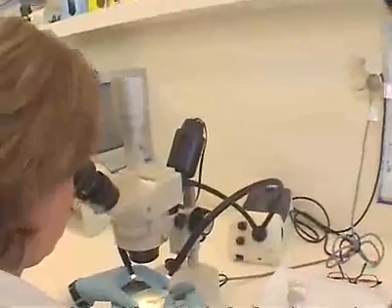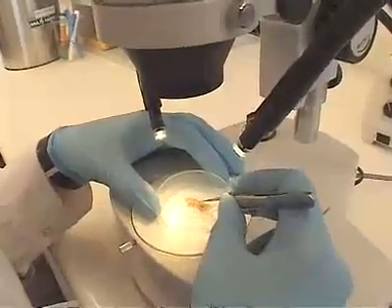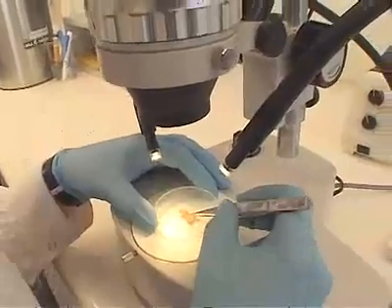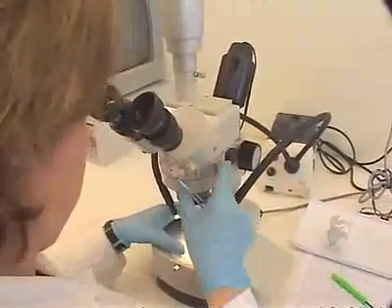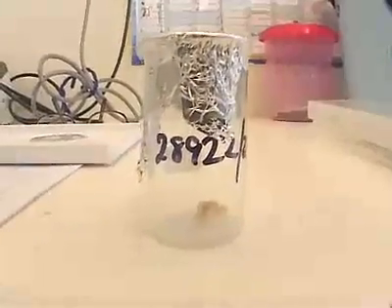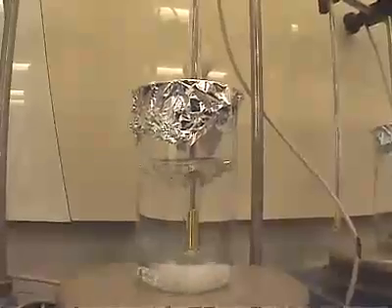The first step in radiocarbon dating is a physical pretreatment. By that, what we mean is looking at a sample to see whether or not the sample is what it's supposed to be and whether there's any contamination in it. Kelly here is looking under the microscope at a sample of wrapping from a mummy. A client wants to know how old the mummy is, and so has sent us 2 samples. One is wrappings from around the bandages around the legs of the mummy, and the second sample is from the interior lining of the coffin.